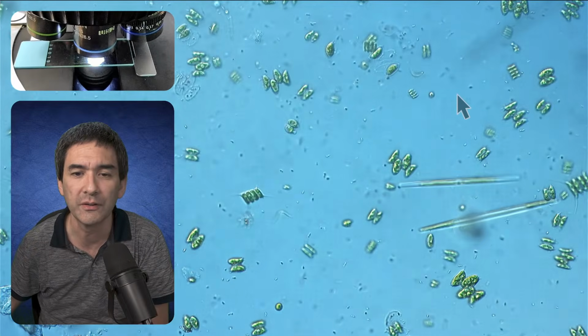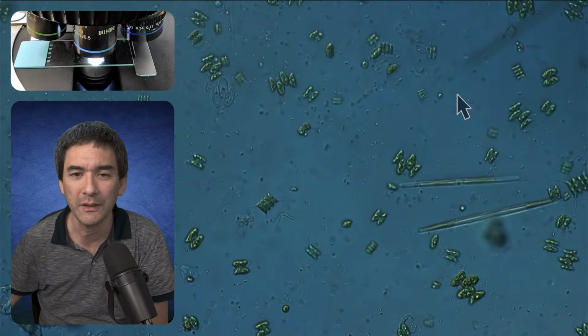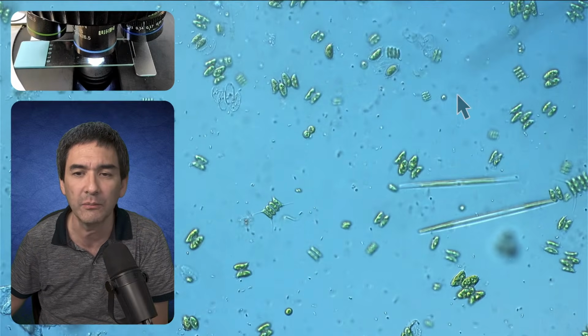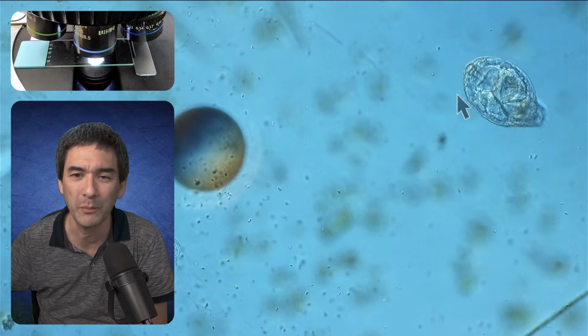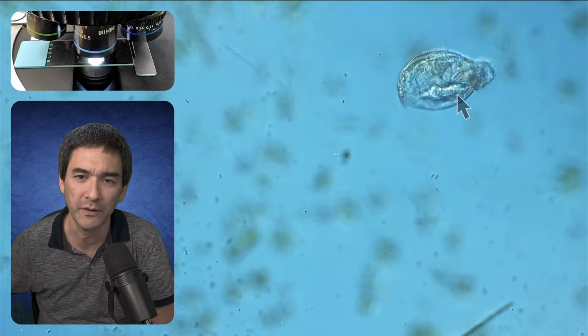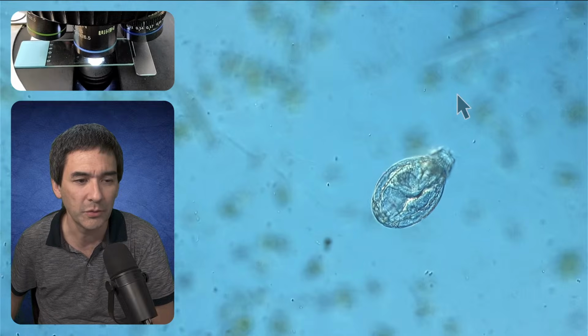Maybe we're going to look at a slightly lower magnification. So it's quite a party going on here. Usually, water samples like this are always best observed live and not in a permanent mount, because simply the movement is gone. You see a whole bunch of other larger creatures as well. Let me turn off the arrow.